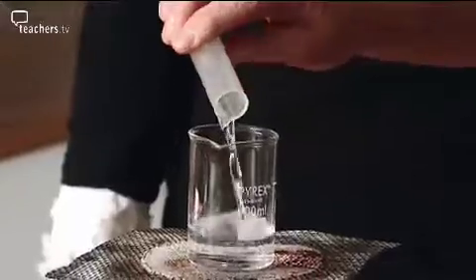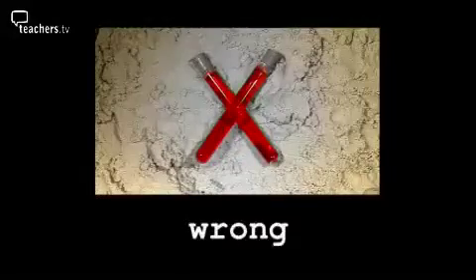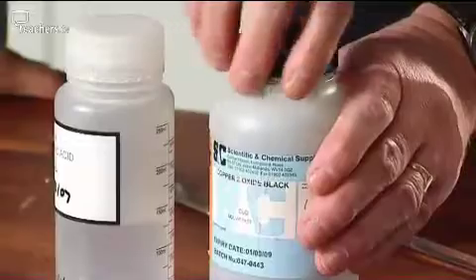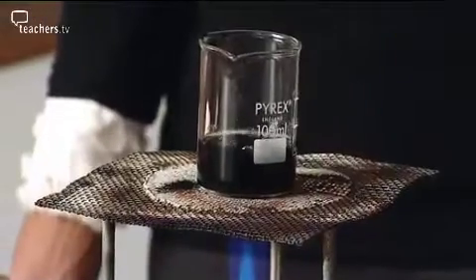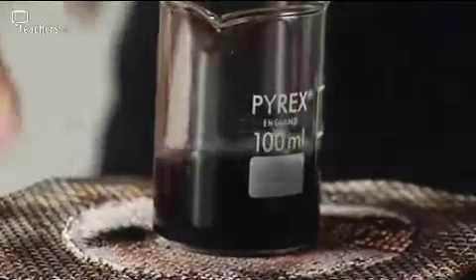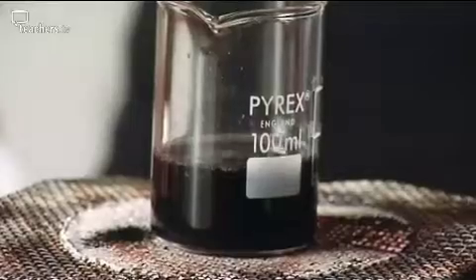Place 1 molar sulphuric acid into the beaker. Stage 1 usually starts off reasonably well. The experiment usually begins to go wrong when students add the copper oxide. The first mistake is to add too much too quickly. So why do students tend to add the copper oxide too quickly? Because they see nothing happening straight away and they just keep thinking, oh, we've got to add more and more to it. So what should they be waiting for?